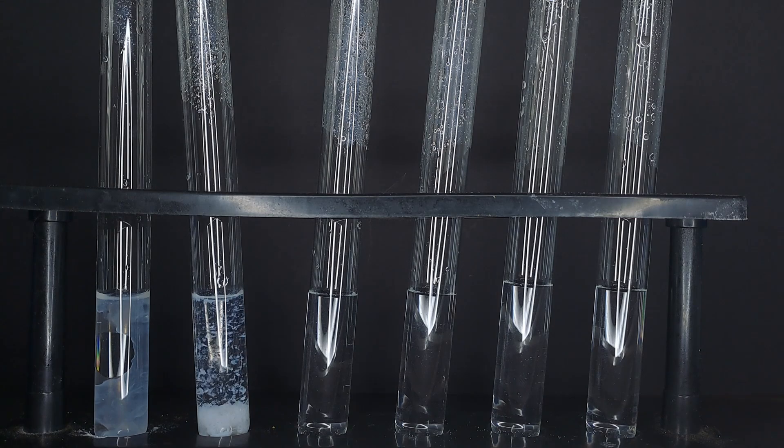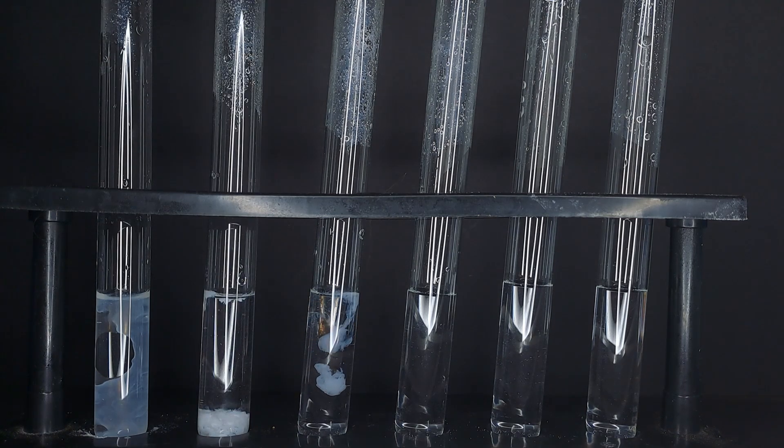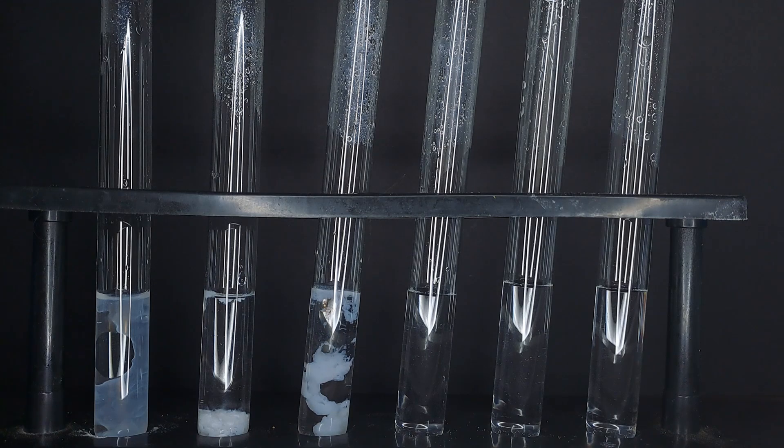In the third test tube we add oxalic acid and get a white precipitate that somewhat resembles a jellyfish.